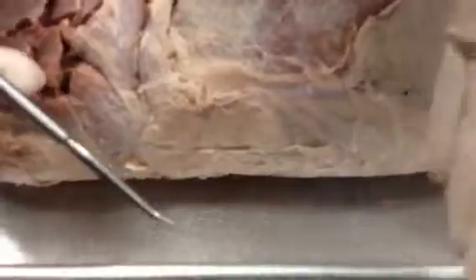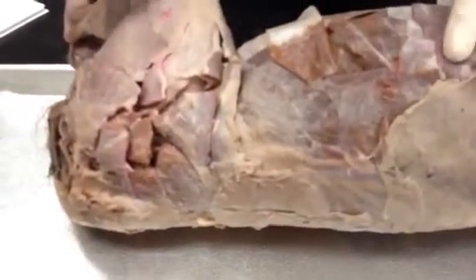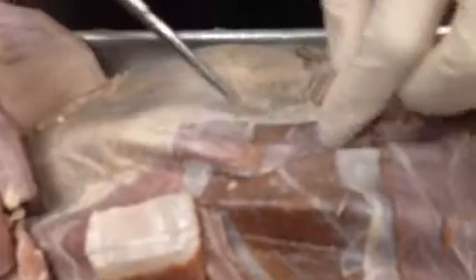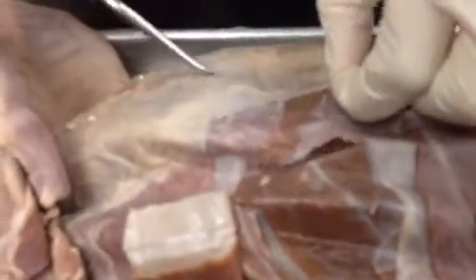is the thoracolumbar fascia, and that's all of this fascia that is on the thoracic and lumbar region of the back. And so fascia is just connective tissue. And then whenever you see aponeurosis, that is the sheet-like tendon connection. So this would be the aponeurosis of the external oblique.